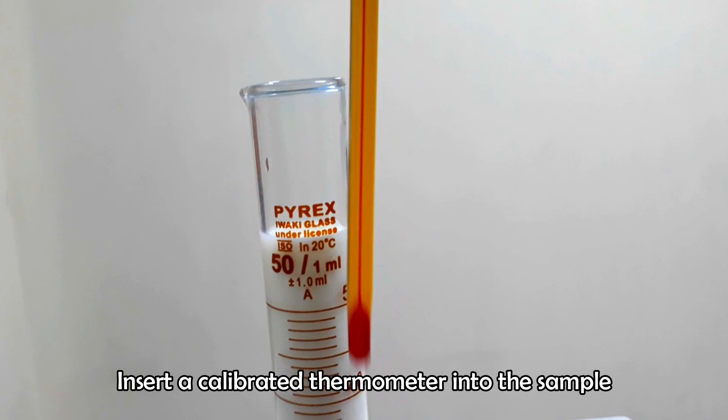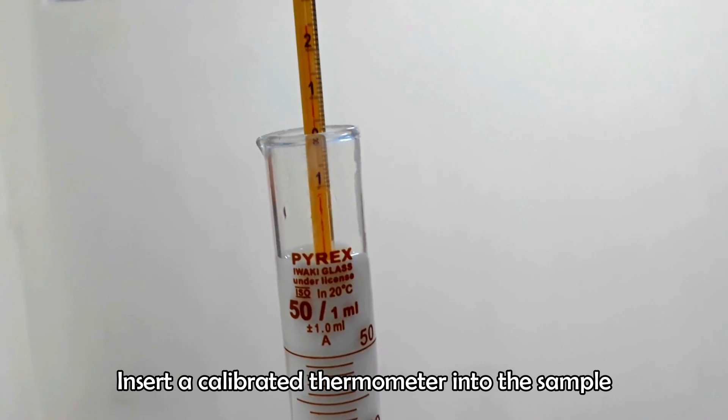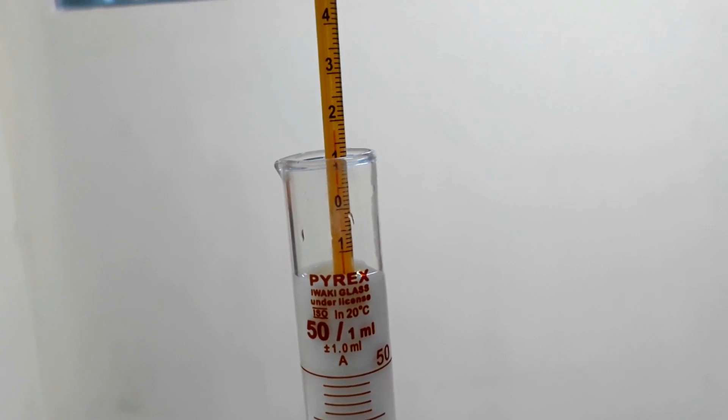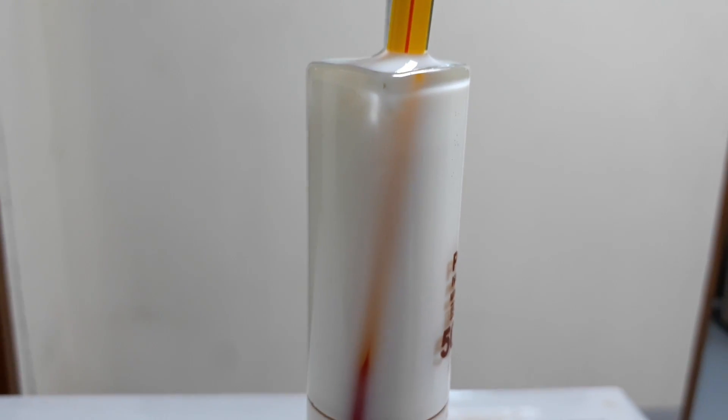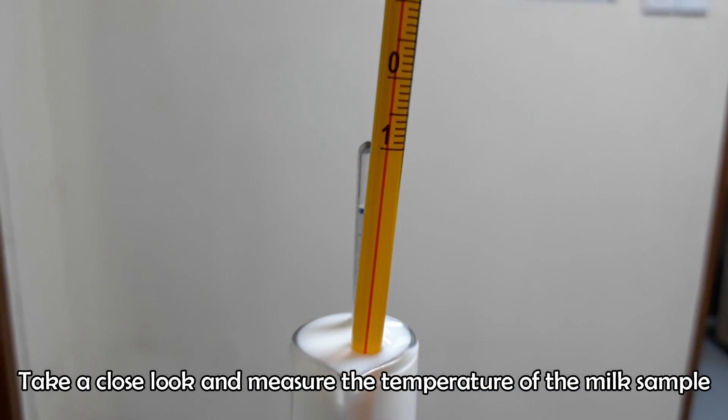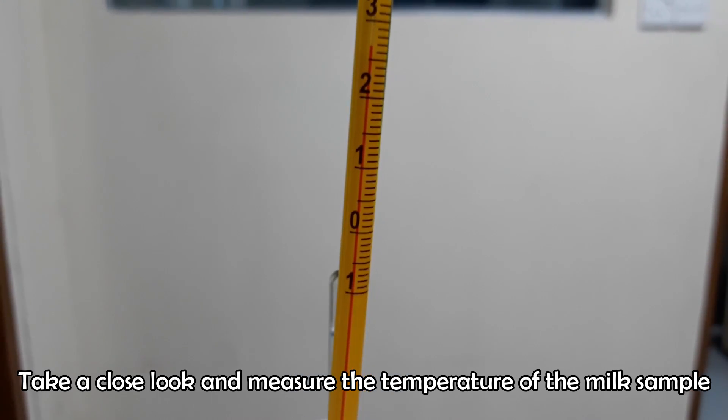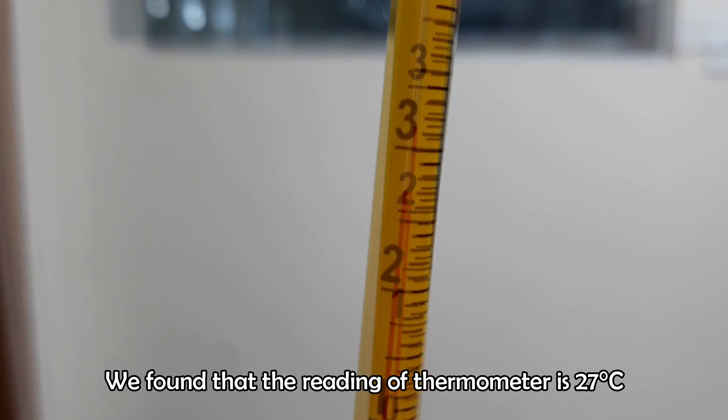Insert a calibrated thermometer into the sample and measure the temperature. We found the temperature of the sample is 27 degrees Celsius. Note the temperature measurement.